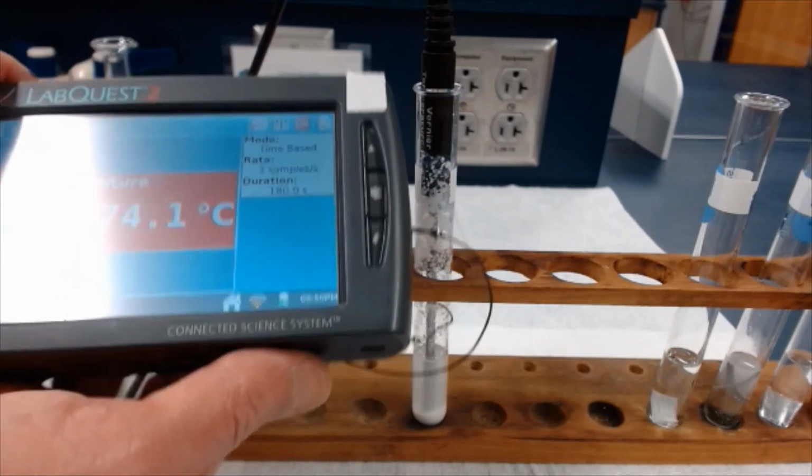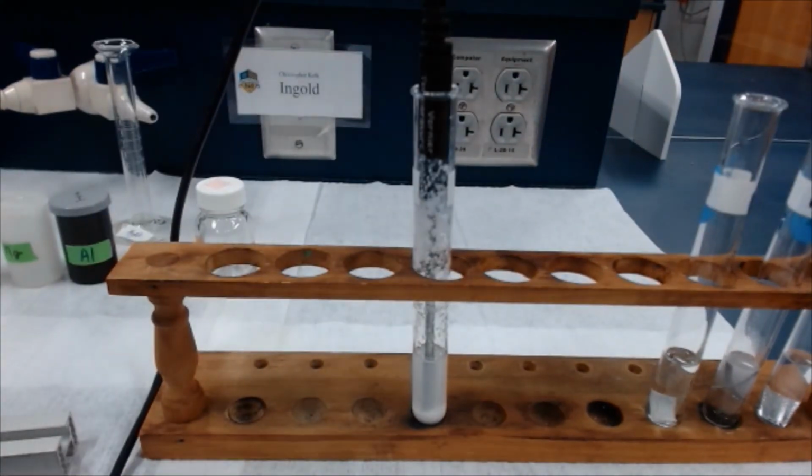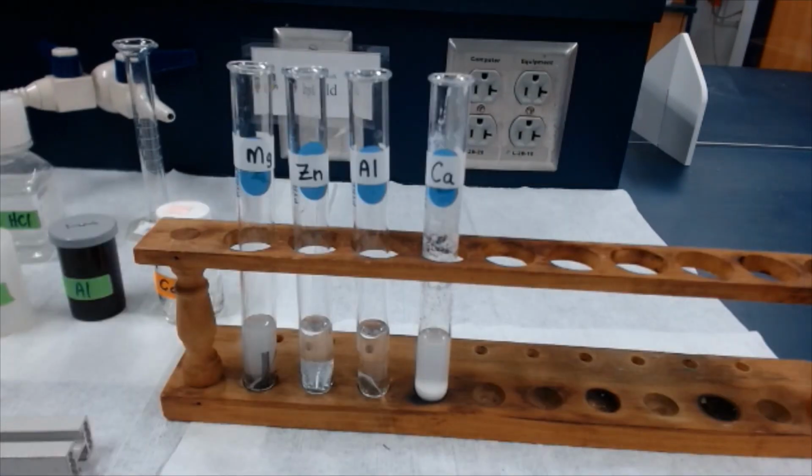All right, guys, I think that should be pretty much it for what you need to complete the analysis in the lab. One last look at the aftermath of our reaction between these 4 metals and hydrochloric acid. The lab then, as the last part of your data collection, is going to ask you to rate the relative rate of reaction now that you've seen all 4. And as it says in step 6 of the procedure, you're going to rate them as 1 as the most vigorous and 4 as the least vigorous.